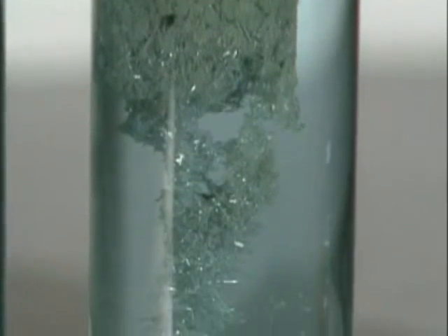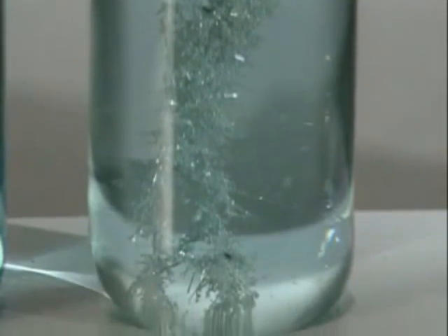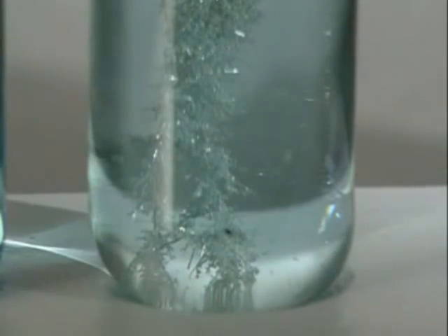After several hours, there's so much silver it glistens. And the colourless solution is starting to go blue.